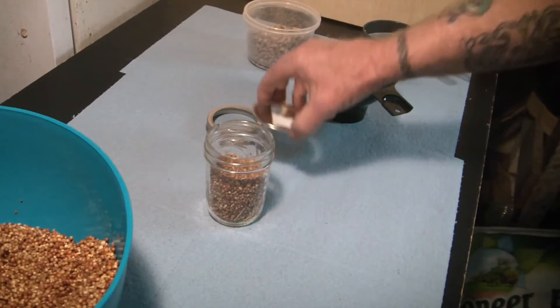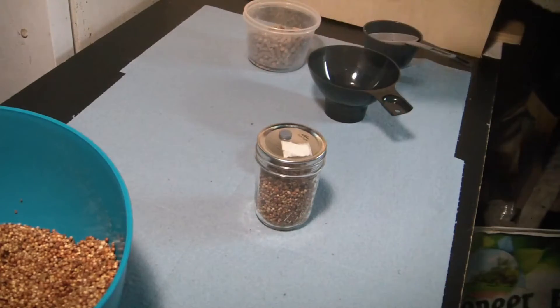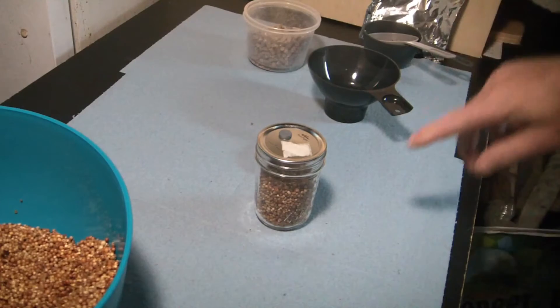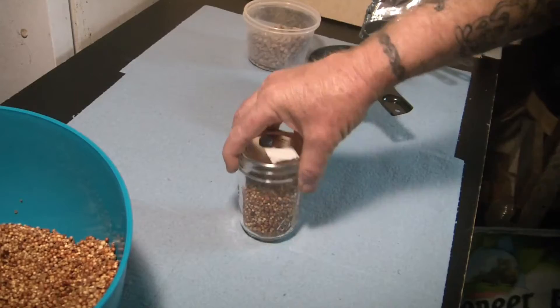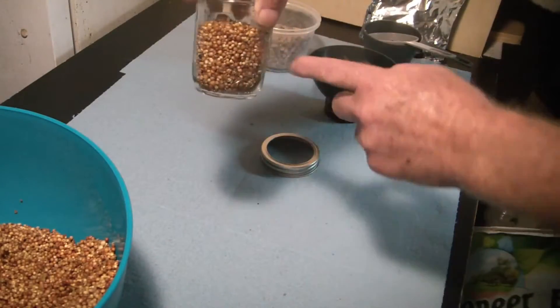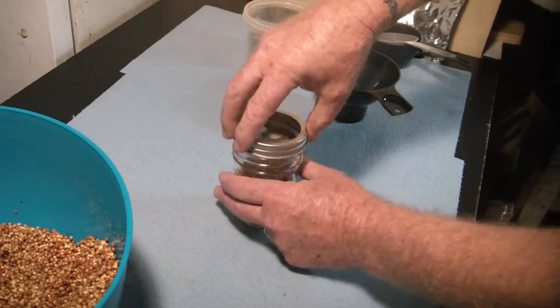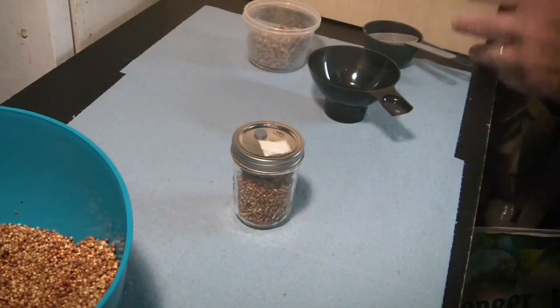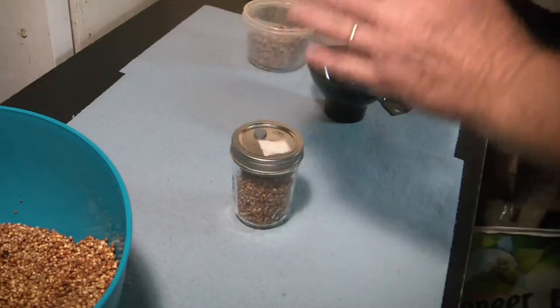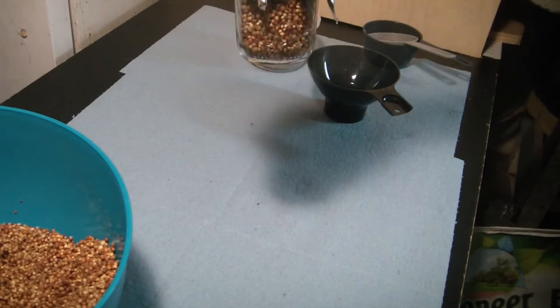The reason I put some hardwood fuel pellets in there is because these jars are going to get a full mil, and that's a lot for this little jar. You can get away with half a mil, but I like to squirt half a mil on two sides after they're processed. This will expand a little bit. Set it up with a foil cap, and these are ready to process.